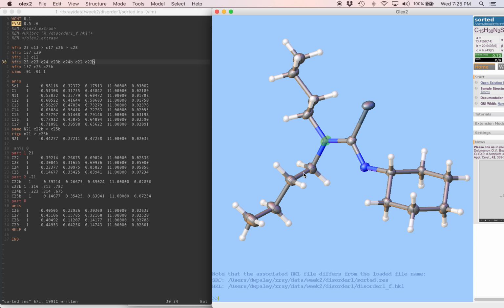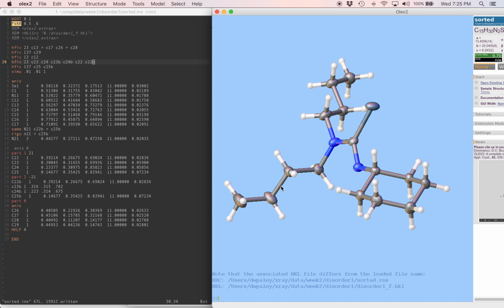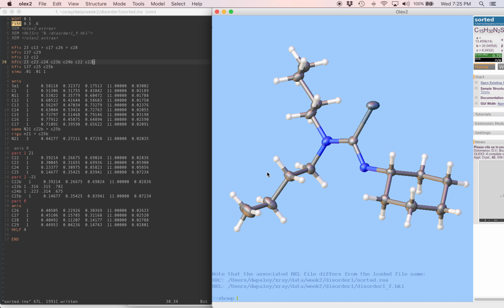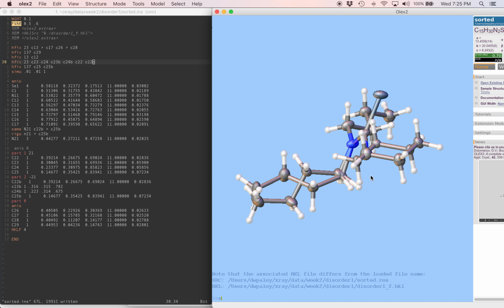Let's check on part 1. We can see by looking at it that there doesn't seem to be any problem here. 1.47 is good for a carbon-nitrogen bond, and 1.54 is perfect for a carbon-carbon bond. And these angles are also pretty close to ideal. Do show P to show everything together. There's one more thing to take note of.